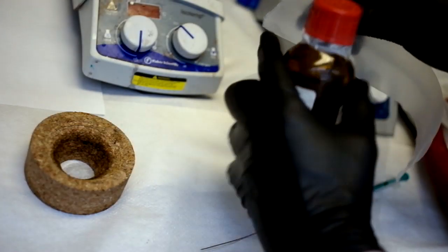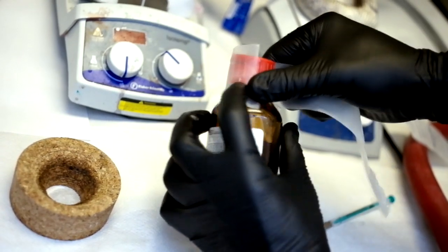Once you have finished, immediately reseal the TBP underneath the fume hood using parafilm wax.